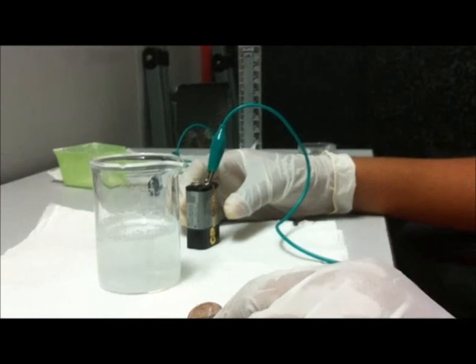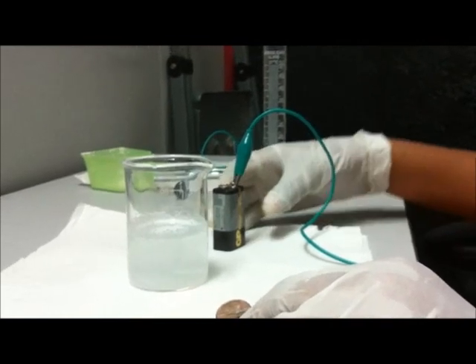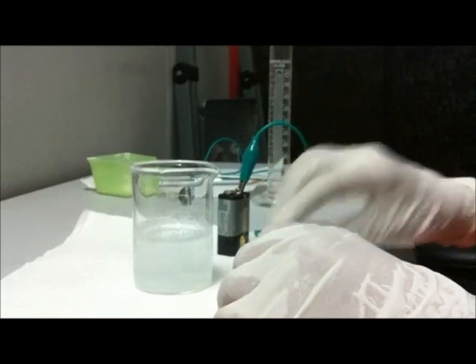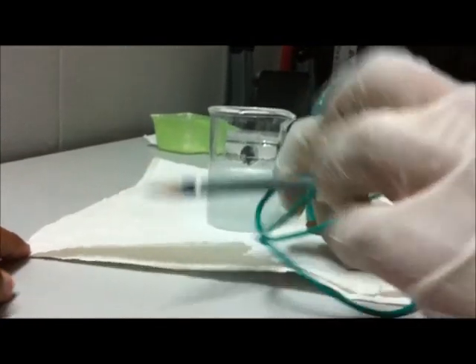We are now reconnecting the coin, just making sure everything is tight. There it is, it's connected.